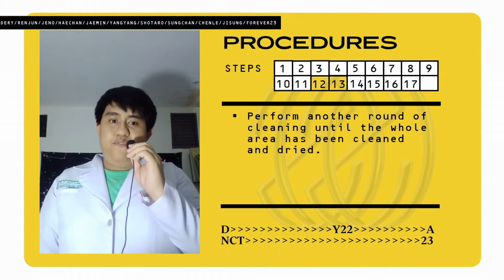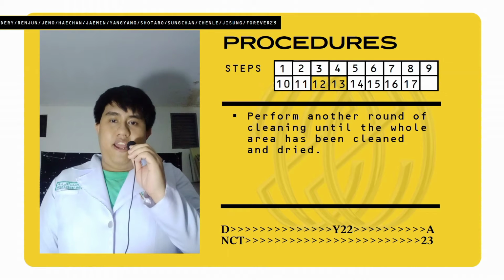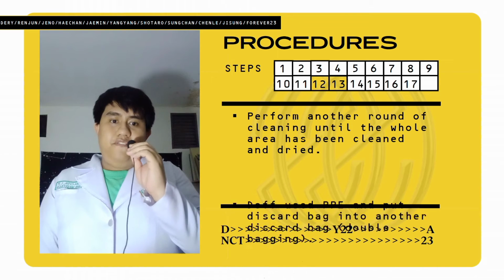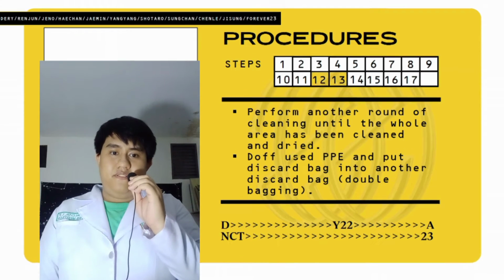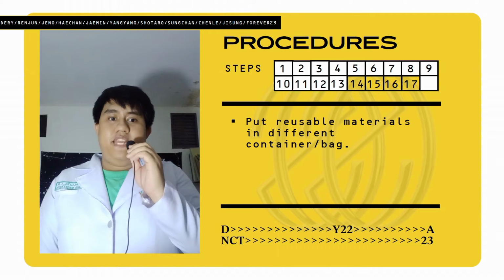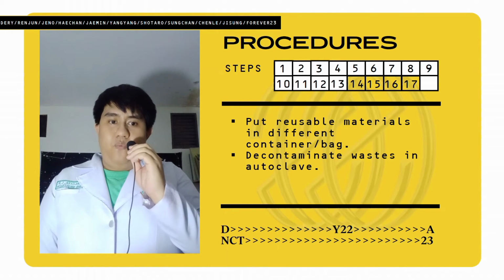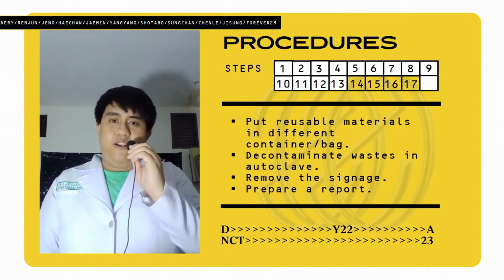Next, we have to perform another round of cleaning until the whole area has been cleaned and dried. Doff used PPE and put discard bag into another discard bag, or what we call the double bagging. For the remaining parts, we have to put reusable materials in different containers or bags and decontaminate waste in an autoclave. Next is we have to remove the signage and prepare for a report.